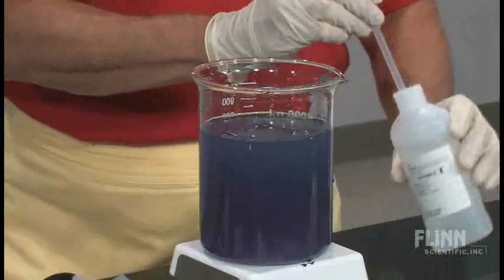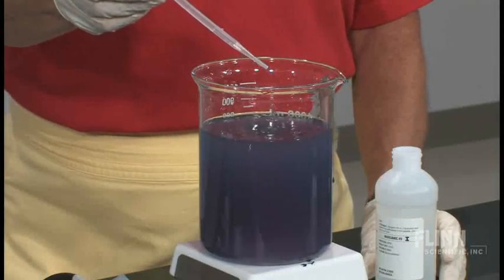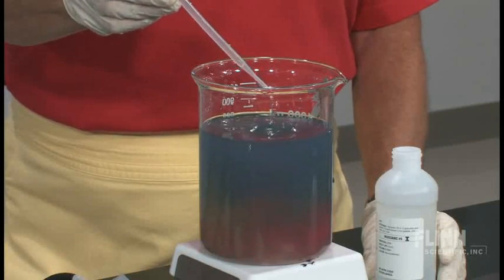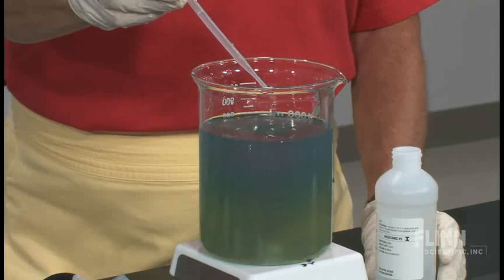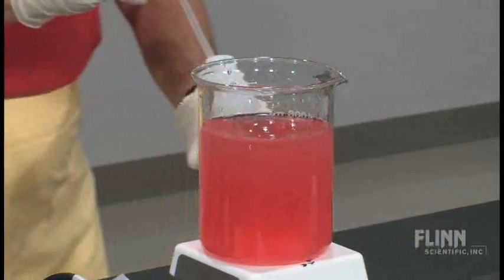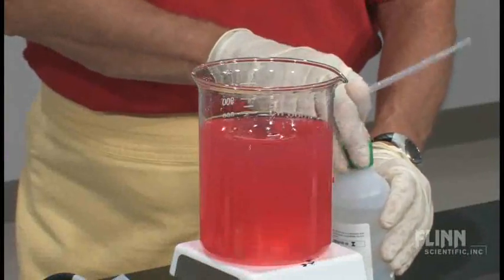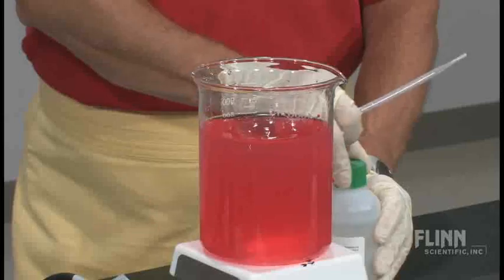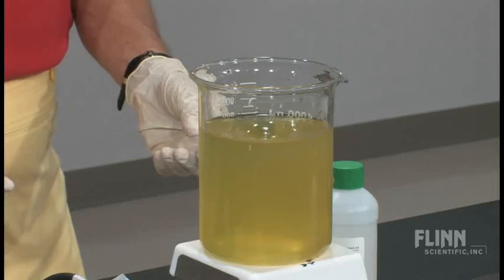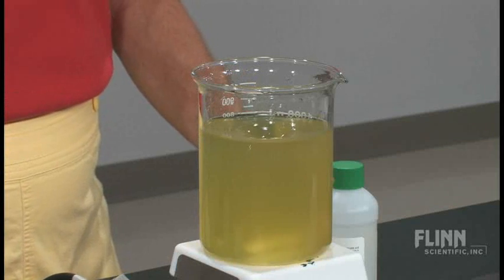I want to add enough to have it go red. Now, because it's chilled, let's see if we have the neutralization occurring — maybe getting a little bit more orange at this point. There's our yellow. Here comes the green, and the ice is simply slowing down this reaction so that you can see the color changes more vividly.